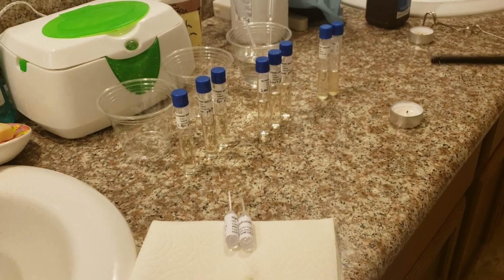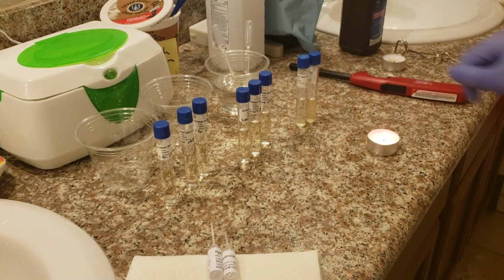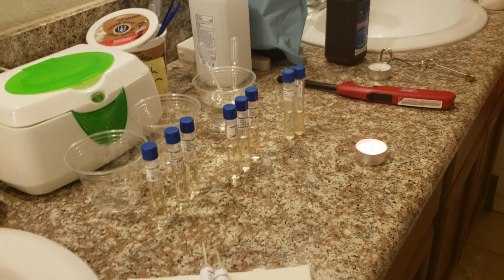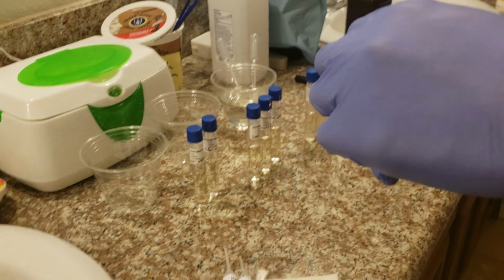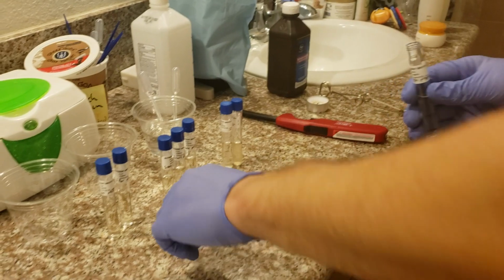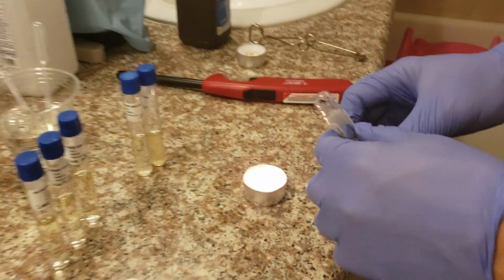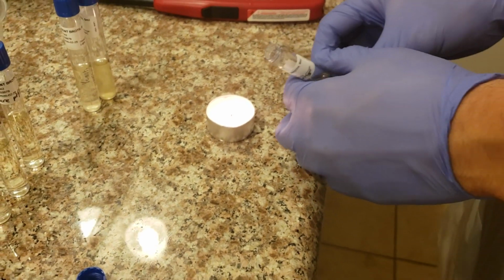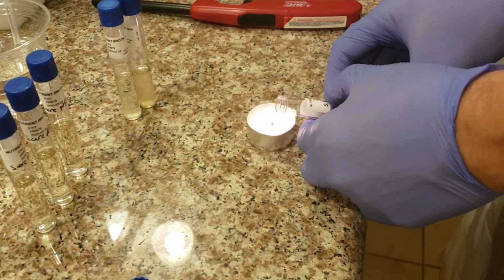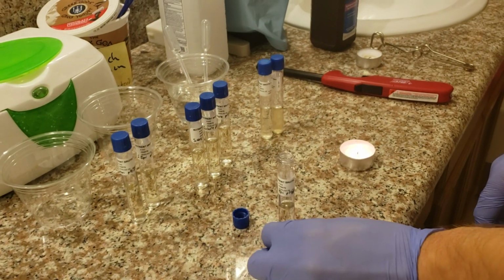We'll start at step 8, which is light the candle. Okay, the candle is lit. Next, we're going to remove the lid from the SFB pH 5 tube, which is this little guy right here. All right, the lid is removed, and we're going to pass the opening over the candle flame to sterilize it. It is plastic, so I'm going to try to keep it from warping in the candle too much. All right, the lip is sterilized.